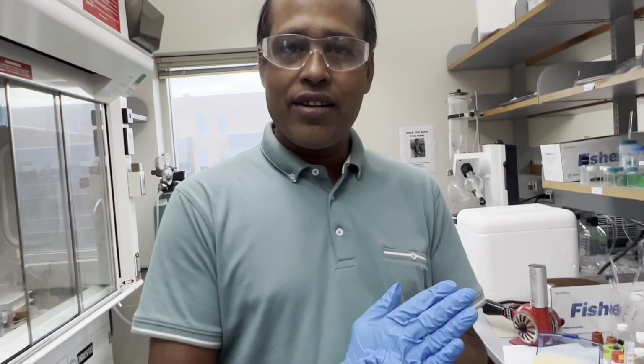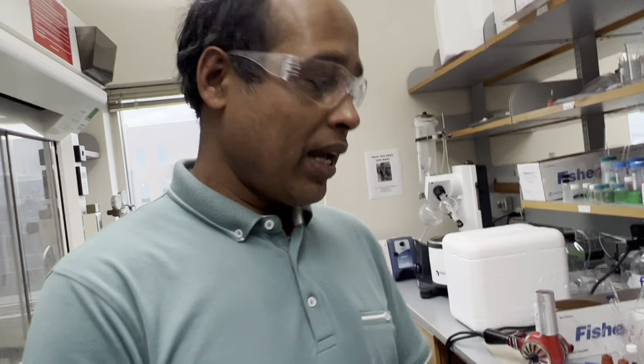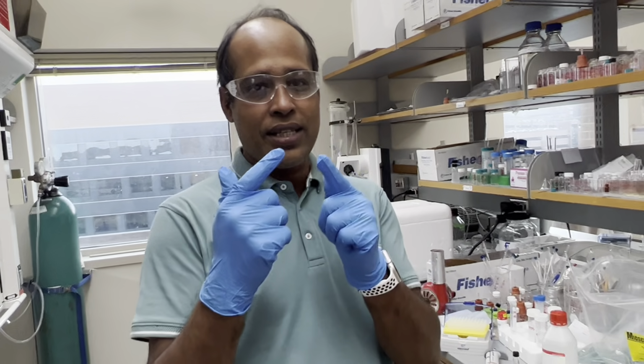So since we added 30 microliter of that HCl solution in water, but we are now using 460 microliter of DMSO, in that case I will add a total of 490 microliter DMSO. But additionally, how much water will be there, because 30 microliters of the HCl solution are more, right? 30 for the 490. But we are going to use 400 microliter.